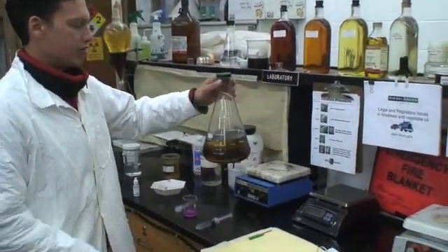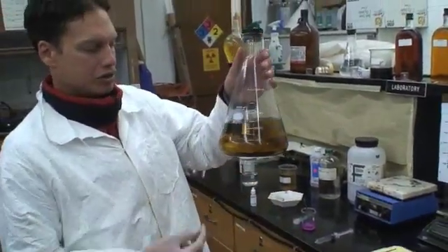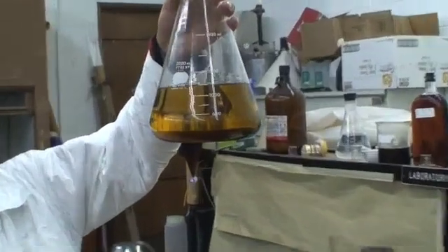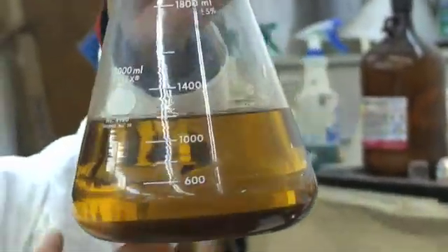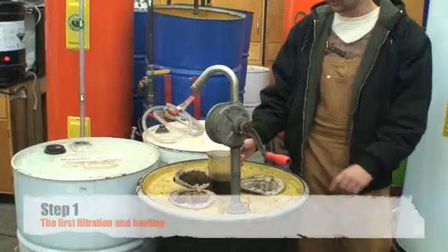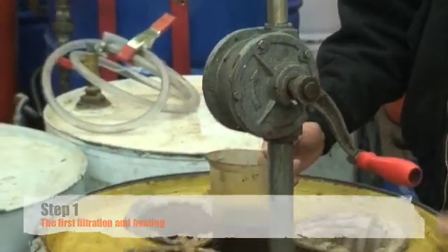After that we can perform a pre-batch using those results to see if it actually separates. It did, so we can go ahead and process the large batch of 35 gallons. What you've got is your used veggie oil in a 55-gallon drum.